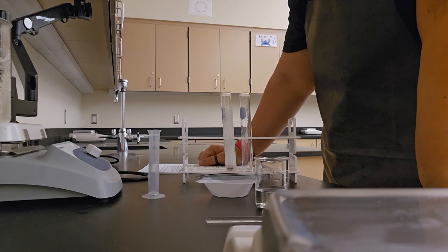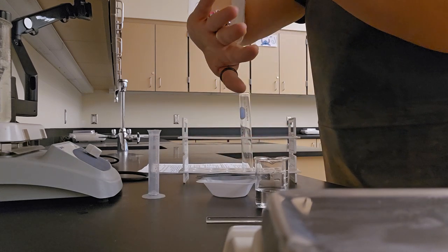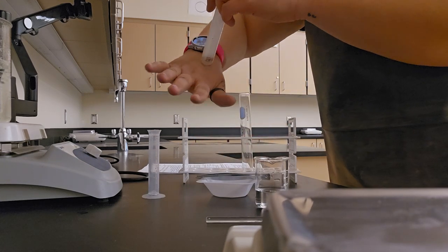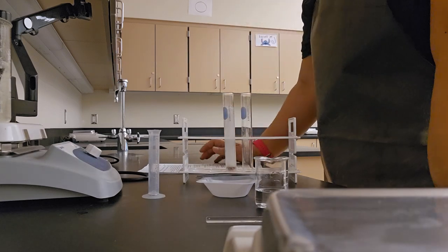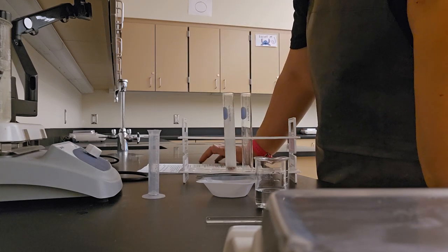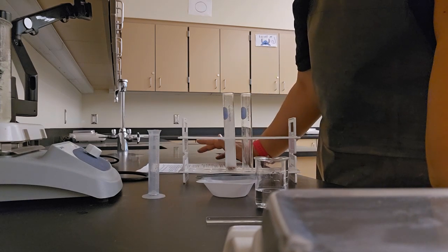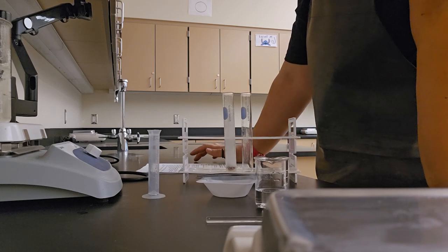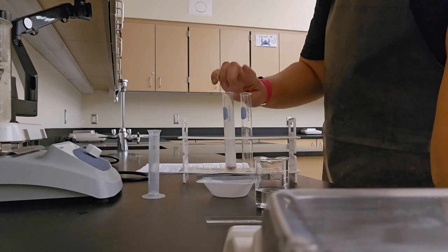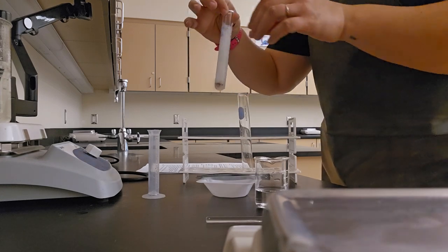Feel the temperature of the test tube with your hand. I like to use the back of my hand, and I can tell my test tube is warmer than the glass at the top. So for 7A, I would say my test tube got warmer. And for 7B, if it gets warmer, is that endothermic or exothermic? You guys write the right answer. Then we're going to pour this liquid into our other test tube, being careful not to also pour the liver.